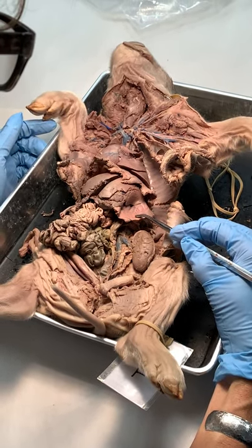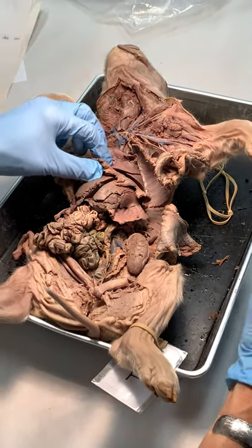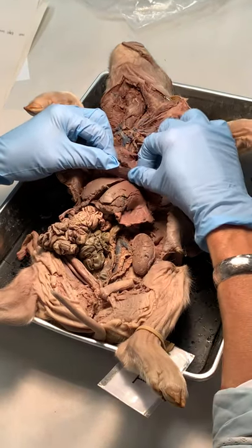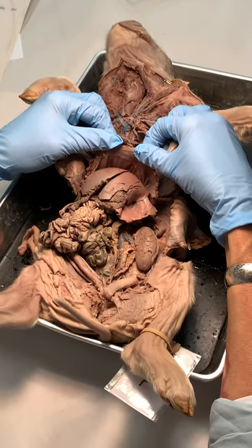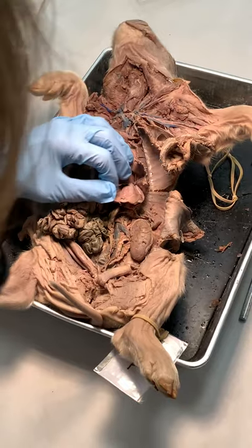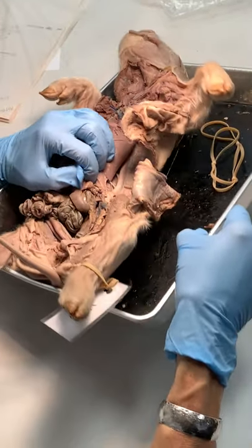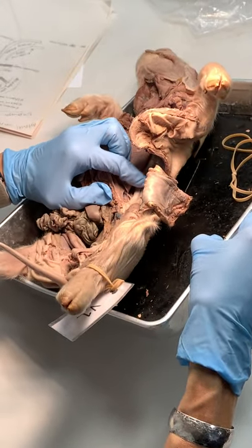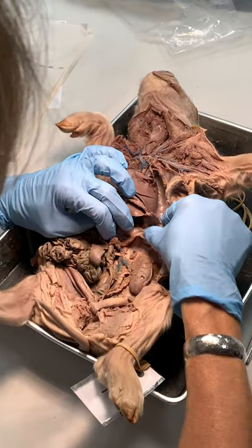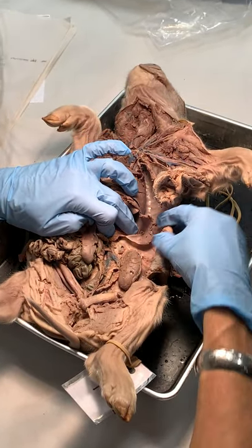This pig's good — you can see the red on the stomach, so that's nice. So here's the diaphragm. I need to go to the abdominal aorta, and I know that if I follow the descending aorta, it punches through the diaphragm at this hole right there.